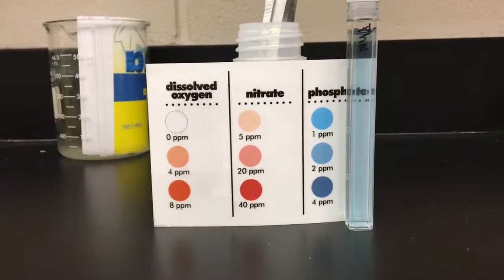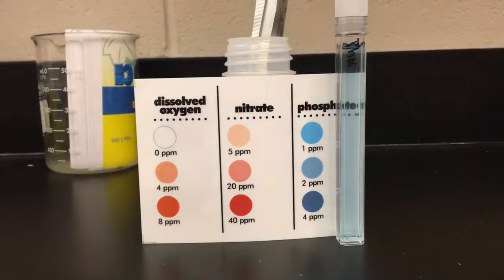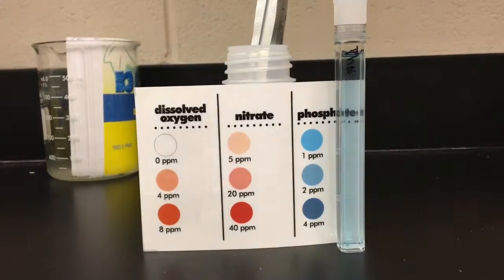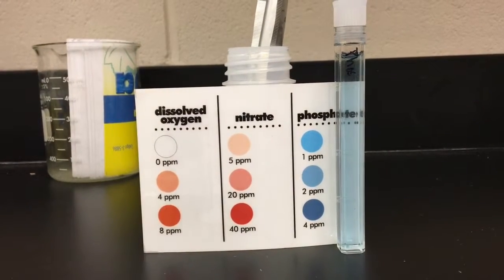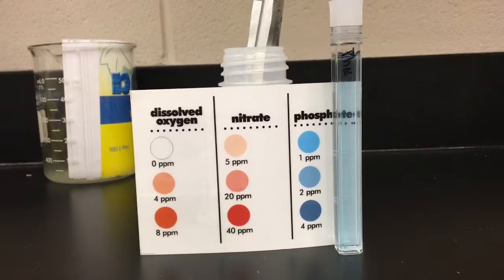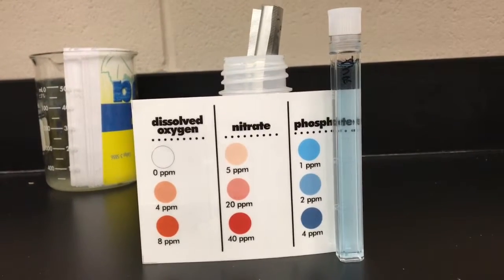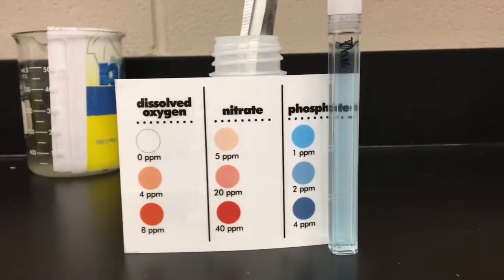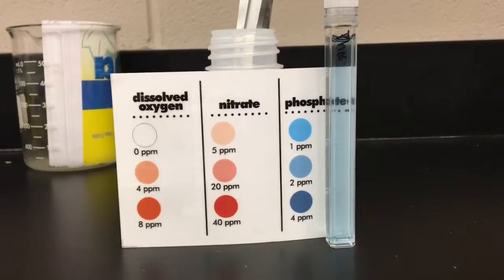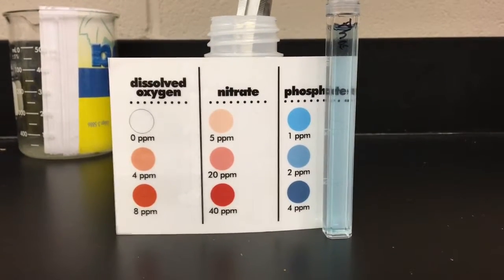Another test we did was for phosphates. Phosphate, like nitrate, is a nutrient that all aquatic plants and animals need in order to grow. Excess phosphate can also lead to explosive growth in algae, which will eventually lead to an extreme decrease in dissolved oxygen. Looking at our sample, our phosphate number looks like it's about 1 part per million.